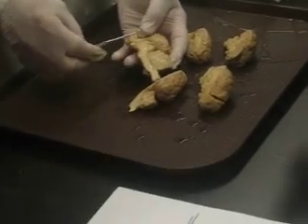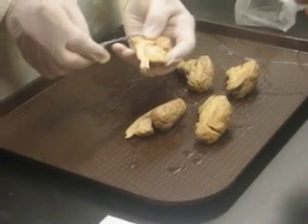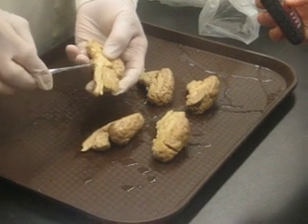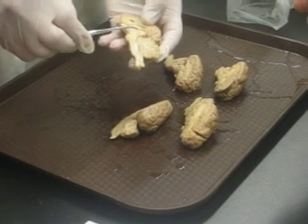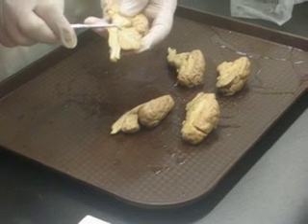Next. Midbrain. Midbrain is going to be from the bottom of the thalamus to the top of the pons. The pons is going to be this thing here. There's the pons, there's the medulla. The pons is kind of poked out this way, and the medulla here. The bottom of the thalamus to the top of the pons would be the midbrain, so it's between my thumb and the probe.